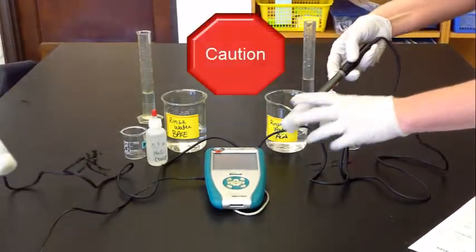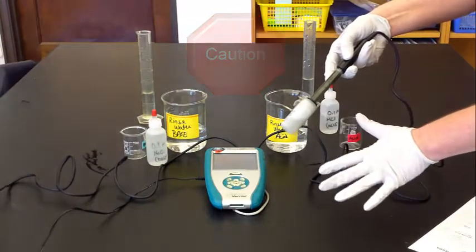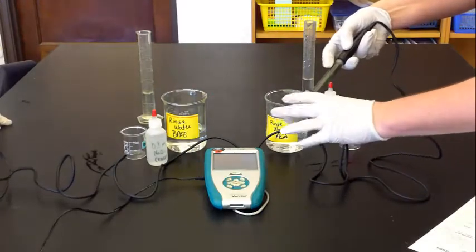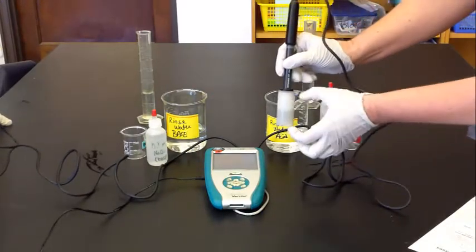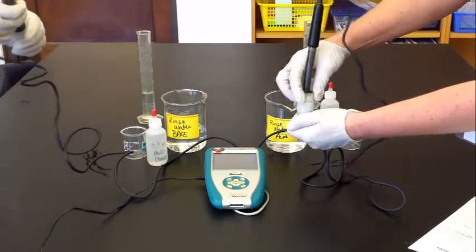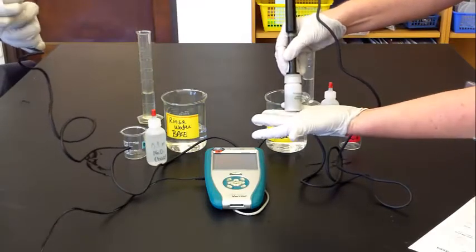Caution: there's a glass bulb. If it dries out, it will shatter and the probe is done—you have to throw it away. So we need to take it out of this buffer solution. To do that, it's sealed. Loosen the cap, hold onto the cap, the bottle, whatever.